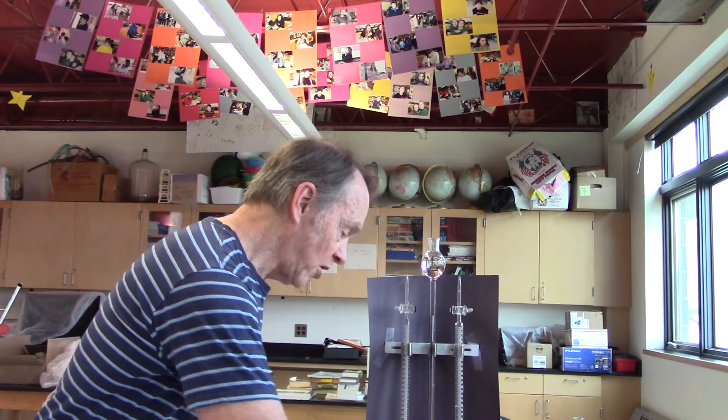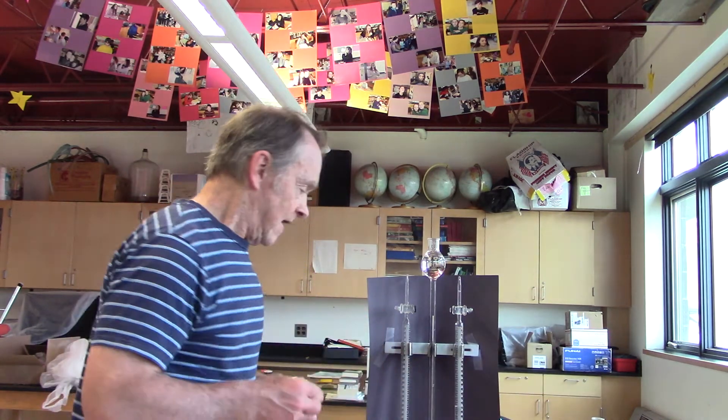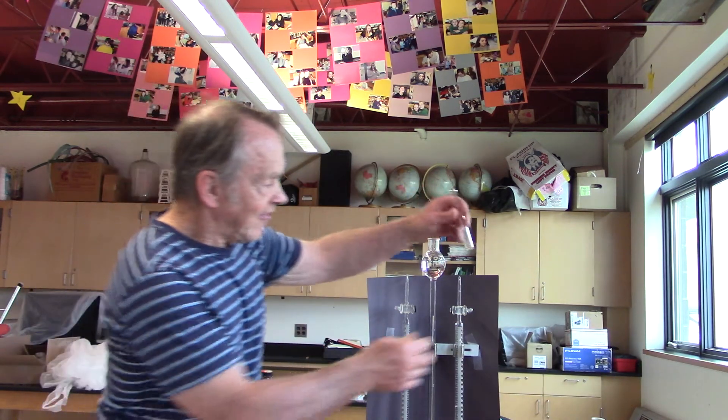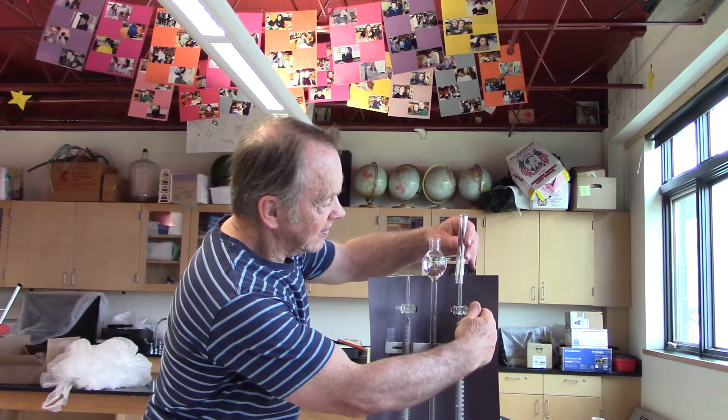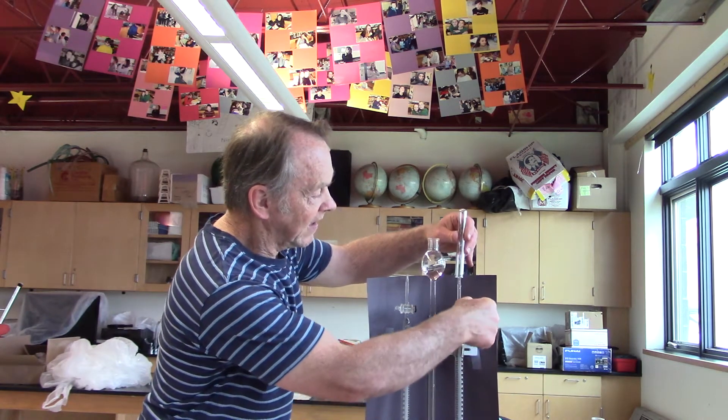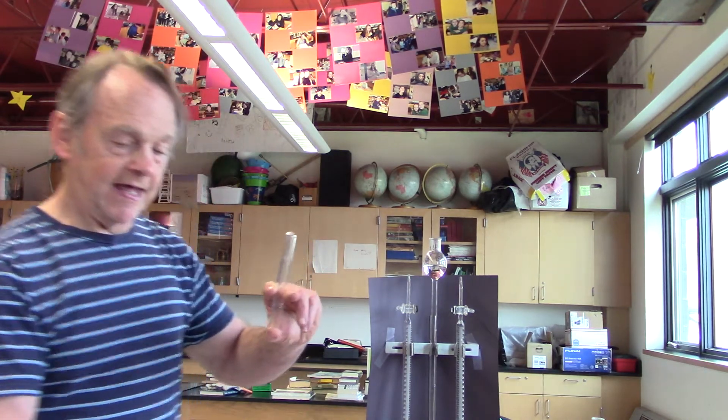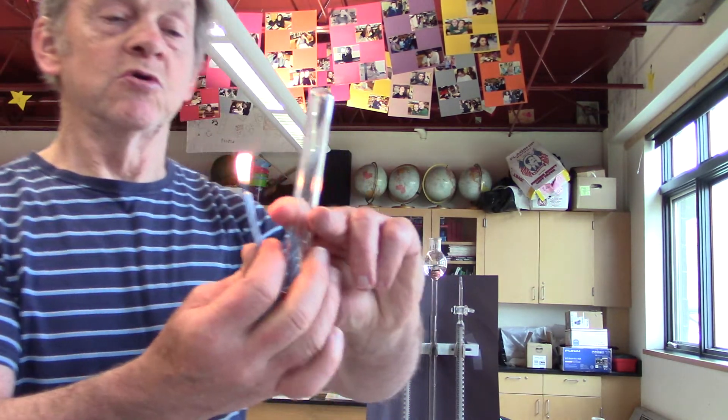So now part 2 of this is the part I like a little better and that is the evidence that this in fact is hydrogen. Okay, so what I think I've got now, and I don't need to put my thumb over it, but I believe I've got a test tube full of hydrogen.